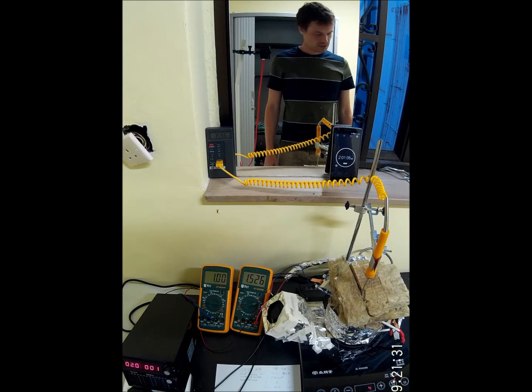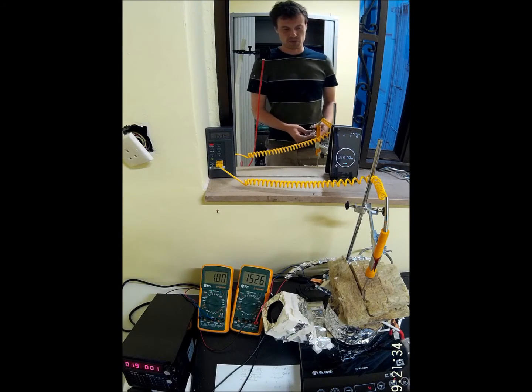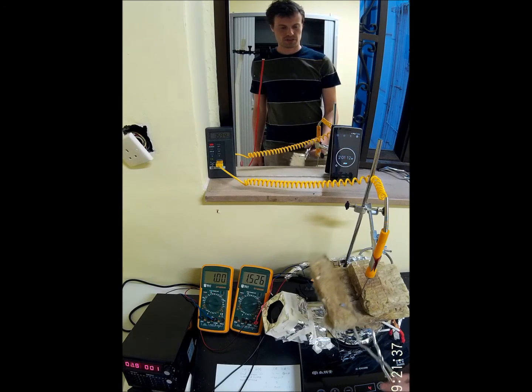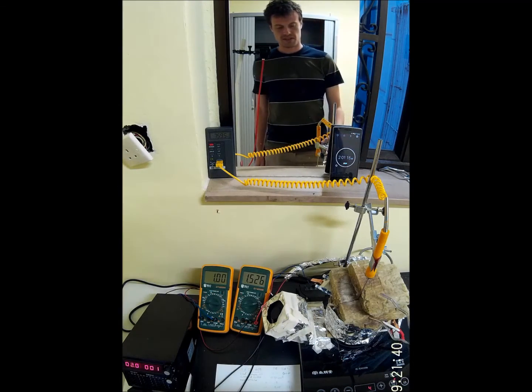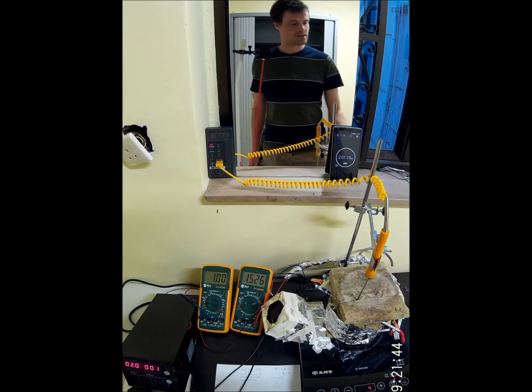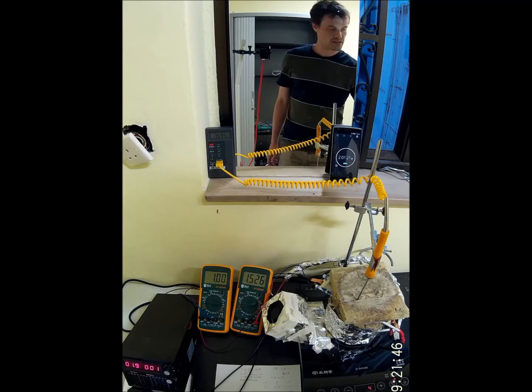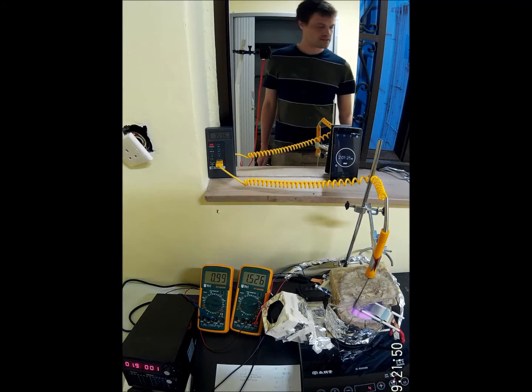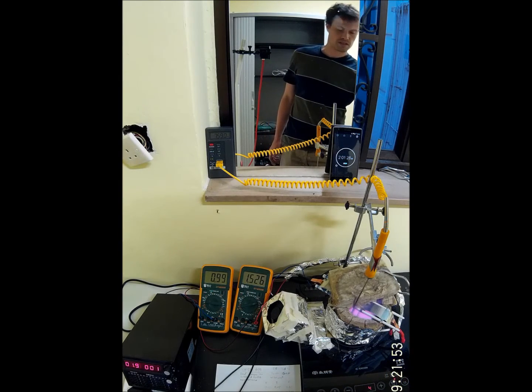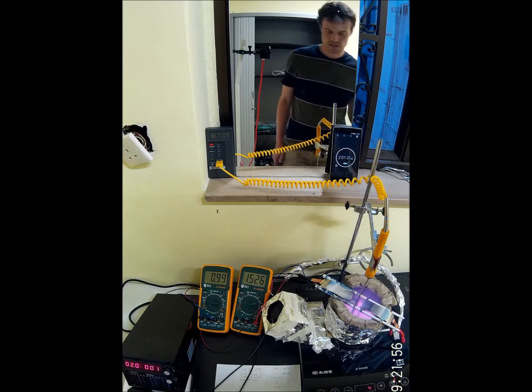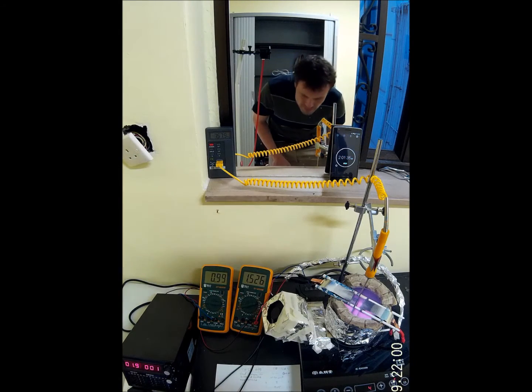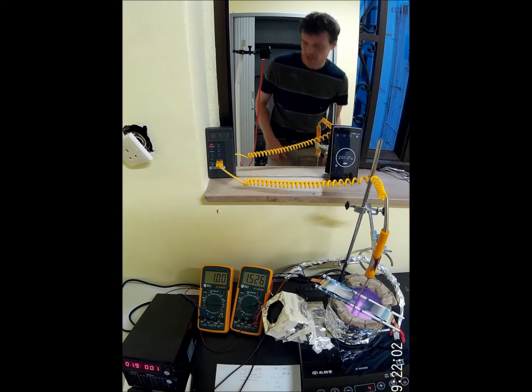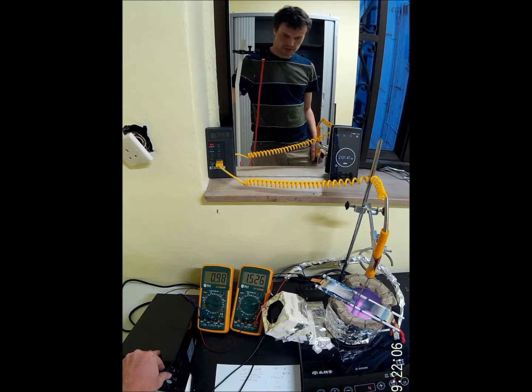Okay, 2 hours are up. So I'll remove the electrodes now. Let's see if we find any carbon. And I'll shut off the electricity.